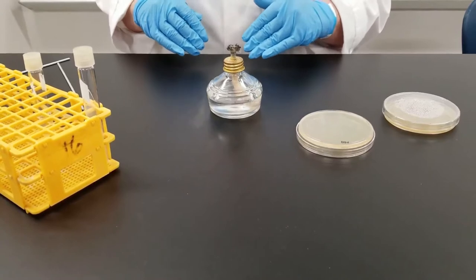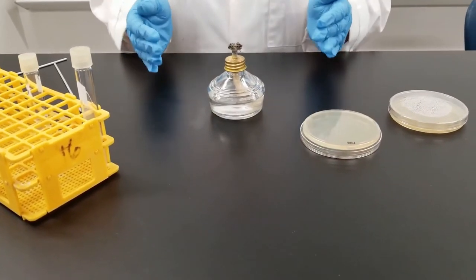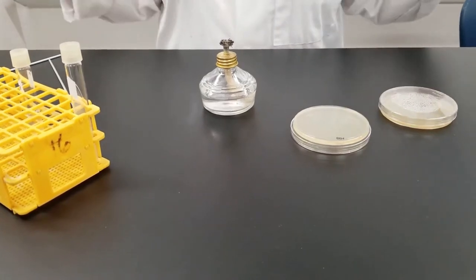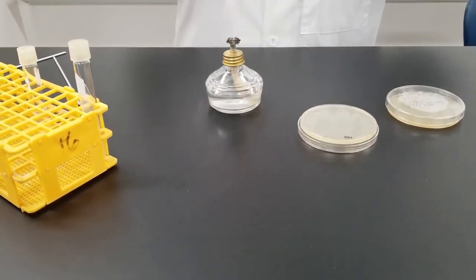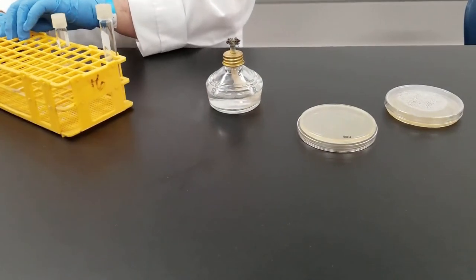So whenever you open a petri dish, open a tube, you want to be within that range so that you don't get contamination from the air or somebody walking by. So you always want to be working in that closed area.